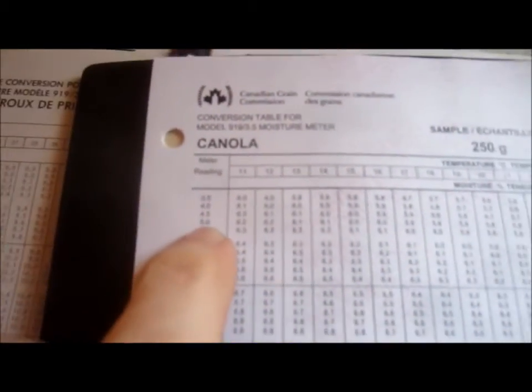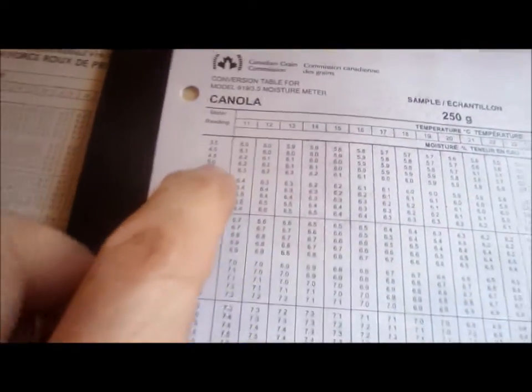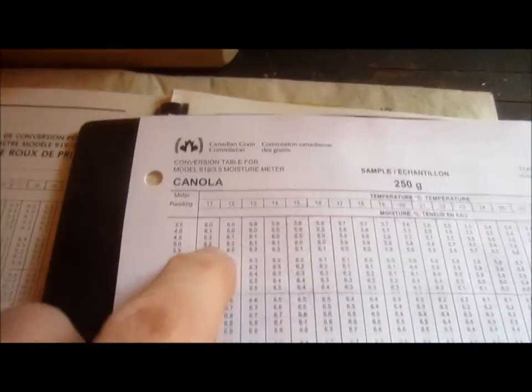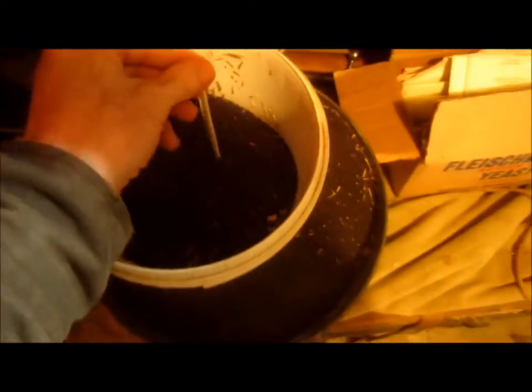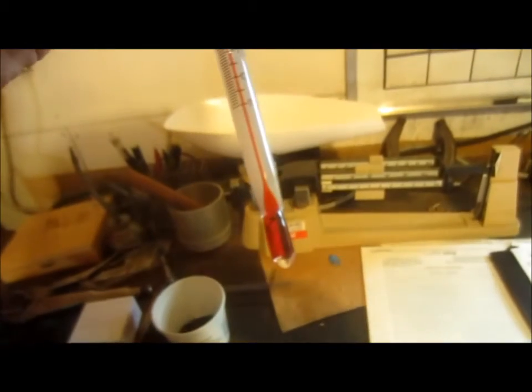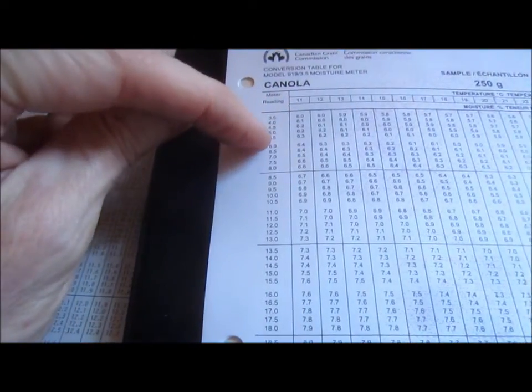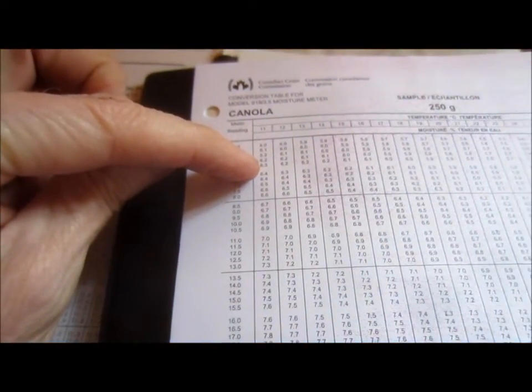Turn off your tester and run over to your chart. Look for meter reading number five, and this is where temperature comes in. The grain is likely below 11 degrees — we'll take a quick look. It's between 10 and 11, so we'll call it 11. Crossing down: meter five, temperature 11 — this stuff is 6.2% moisture, which is really drier than it needs to be.